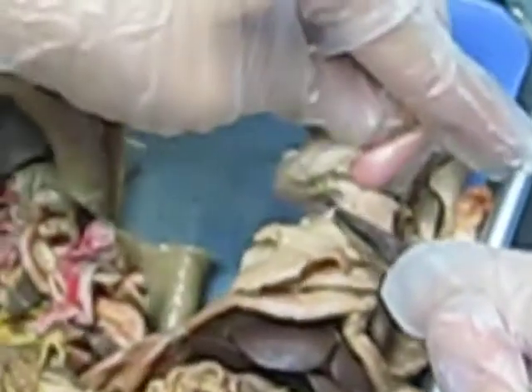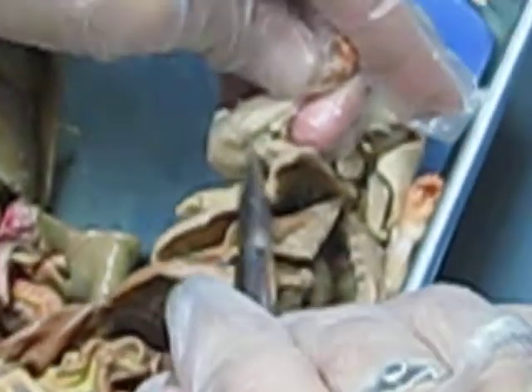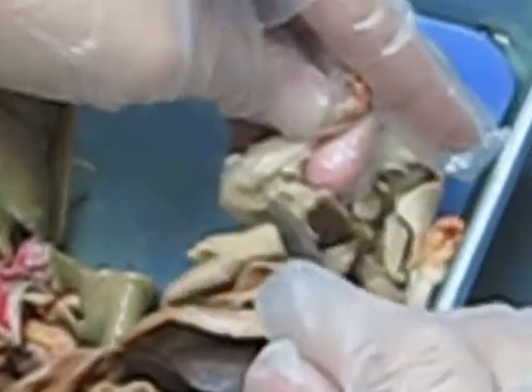And when it comes, you can follow it even further out to the arm right there. It's actually two separate branches, but that one right there is your brachial artery because it's going to your arm. Where's the other one you just pointed out? The lateral thoracic? That is right there.